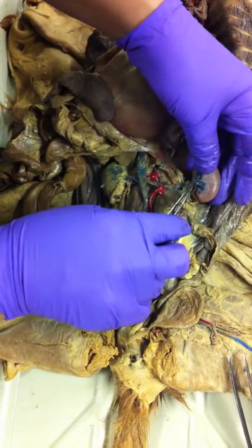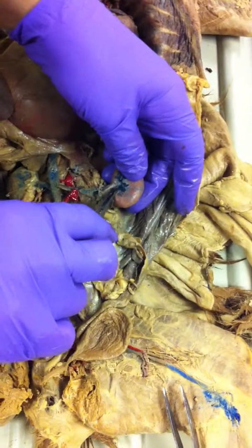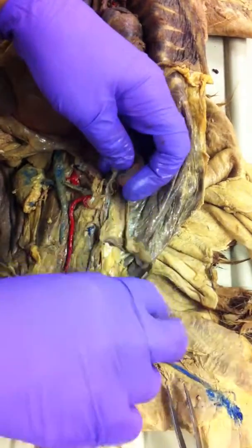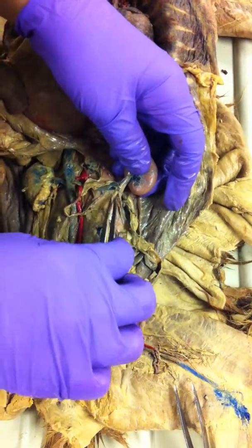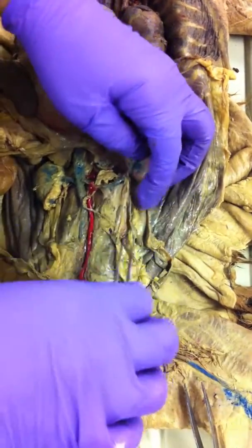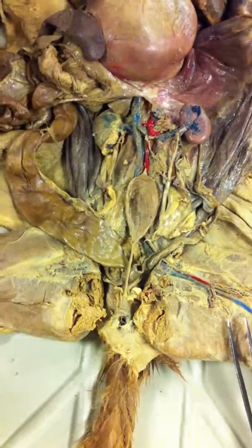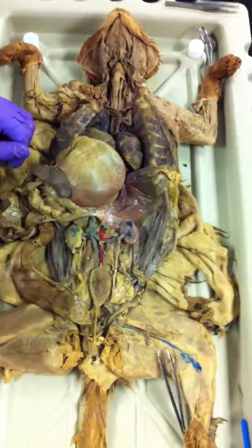Okay. This part of the kidney where the blood vessels come out and go in is called the renal hilum. The other structure that comes out of the renal hilum is the ureter. Okay? This entire structure is your ureter. Ureters, the connection is lost here, but it opens into the urinary bladder, and that's the urethra. So that's your digestive, respiratory, and urinary system.